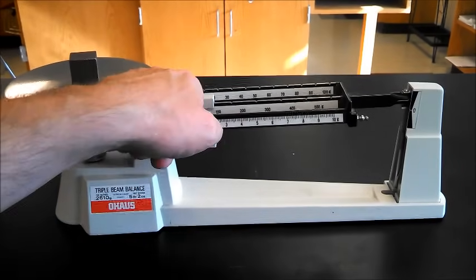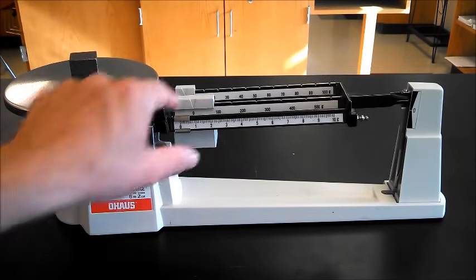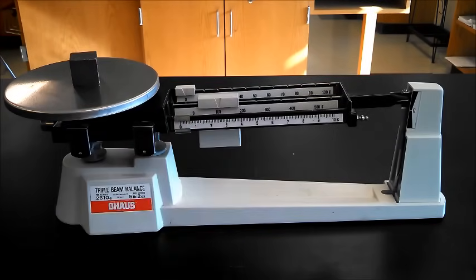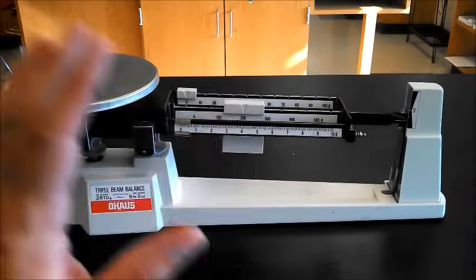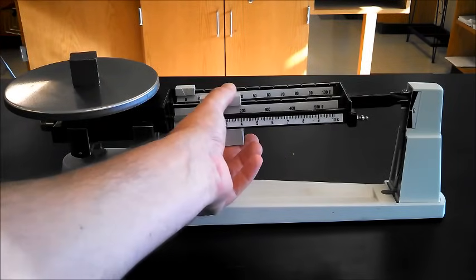Now, we're going to start with the heaviest mass and move this over. Did it go down? No. So, we have to go one more. That time it went down. Now we're going to move it back.